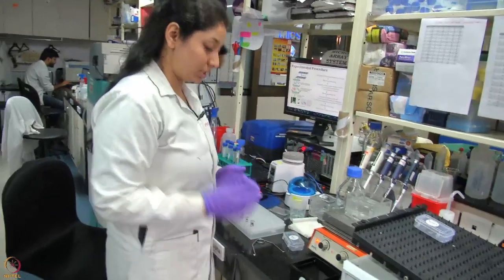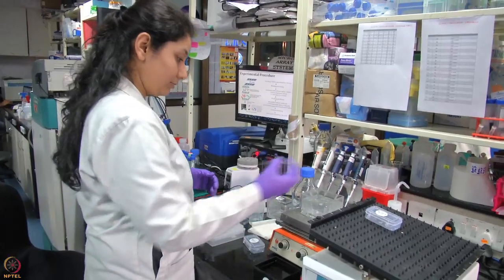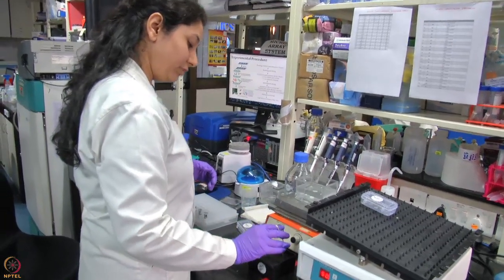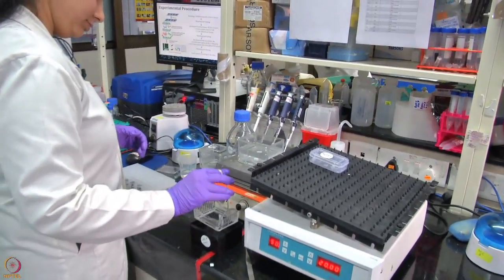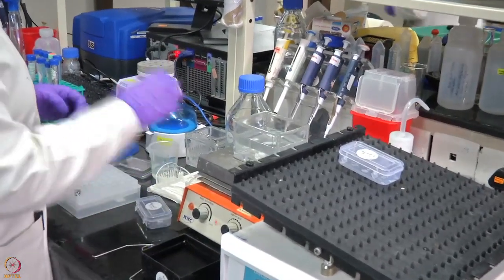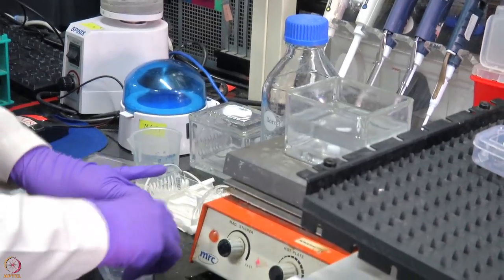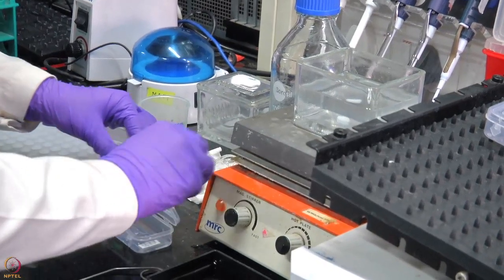Once this washing is complete — 3 times, 10 minutes each — we remove the cassette, rinse it with water to remove extra buffer, and spin it for 2 minutes at 900 RPM. The slide, once dried, is then placed in the box for secondary antibody incubation.